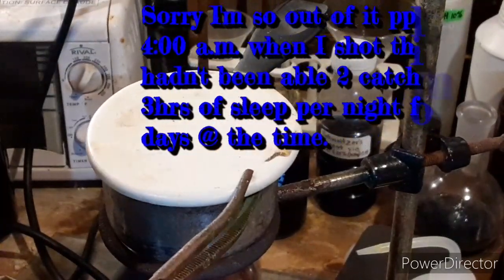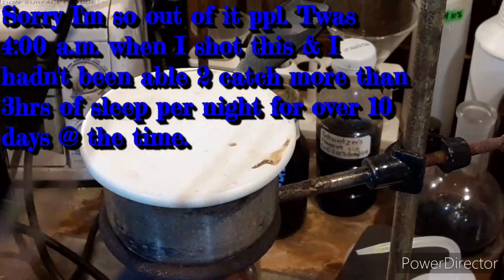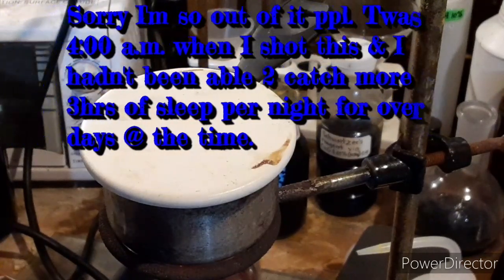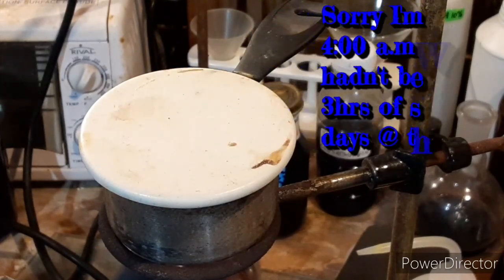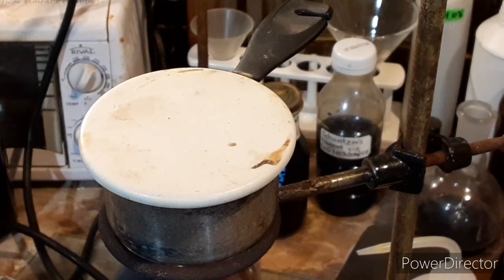What this will yield us initially is some iron sulfide, and we will get potassium thiosulfate as well as some cyanide. However, we're going to decompose all that so that we'll be left with just the iron sulfide — so I guess that's not decomposing — and we're decomposing the thiosulfate.